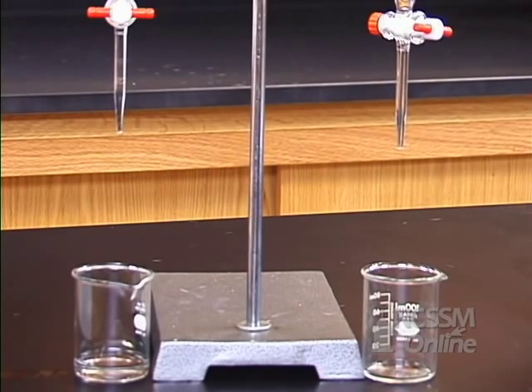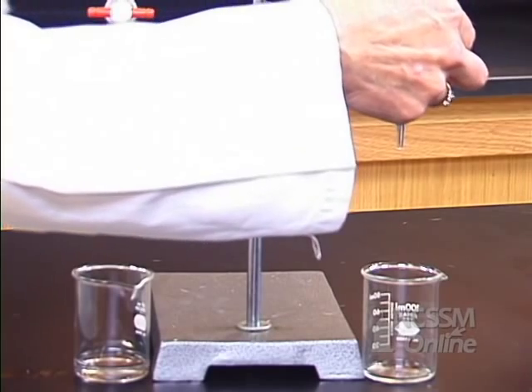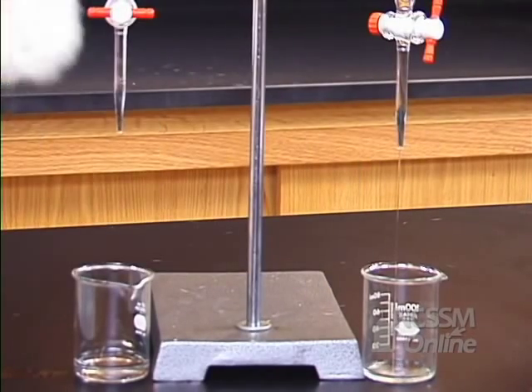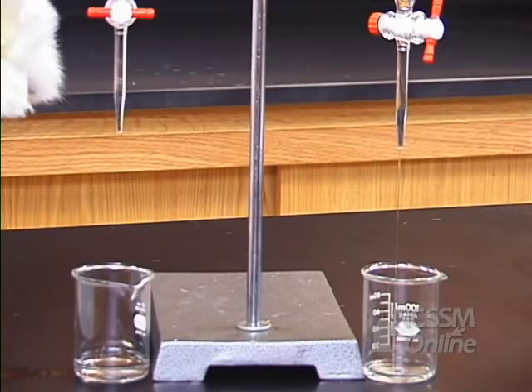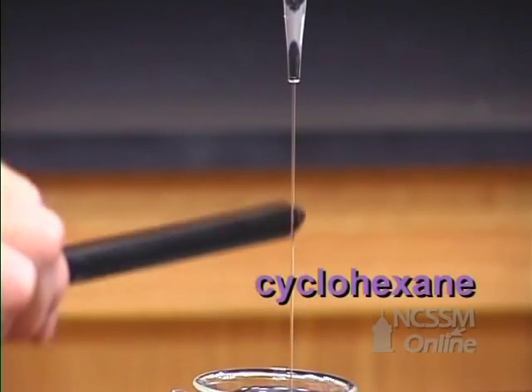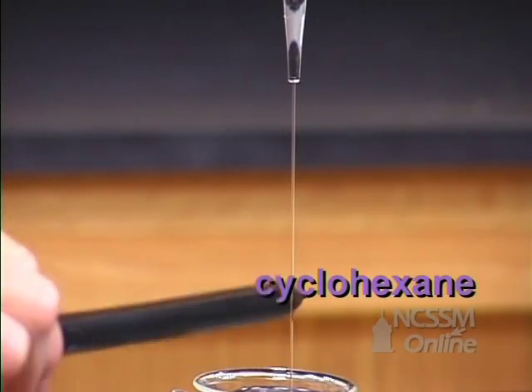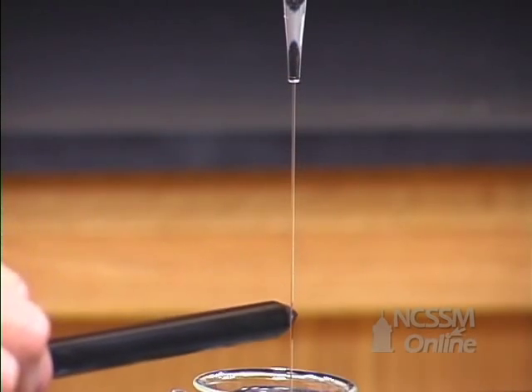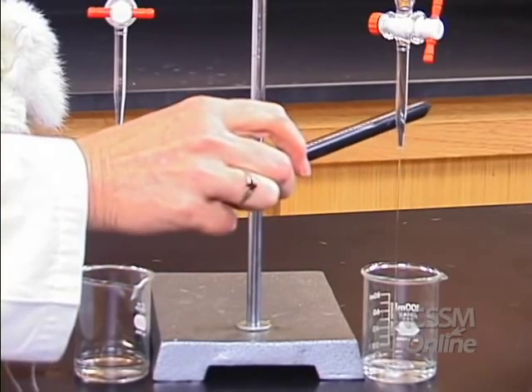Now let's look at cyclohexane. No effect.